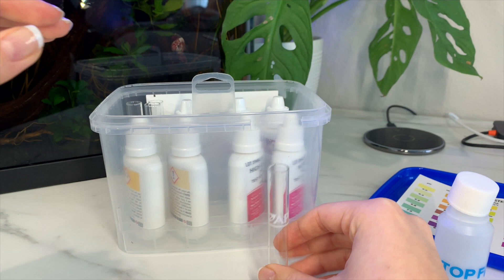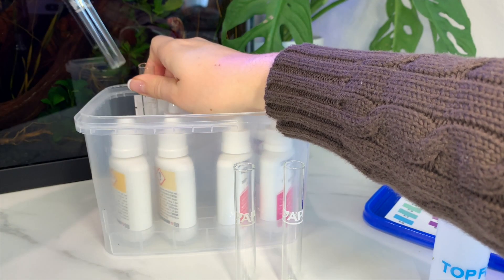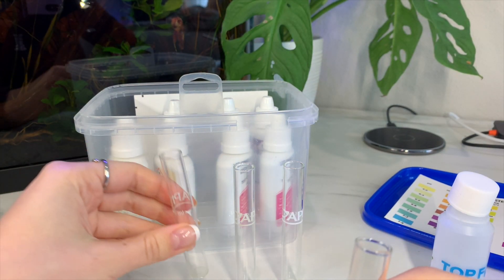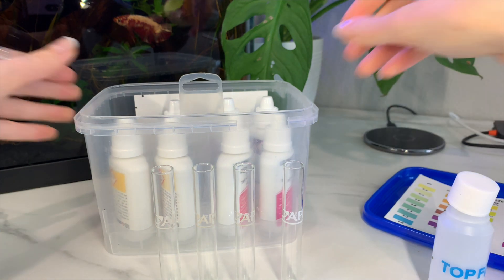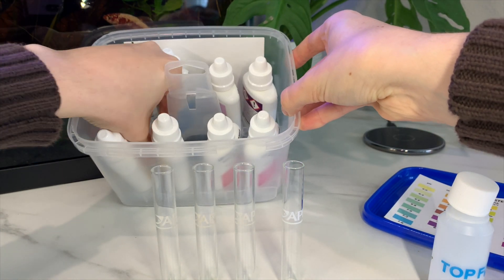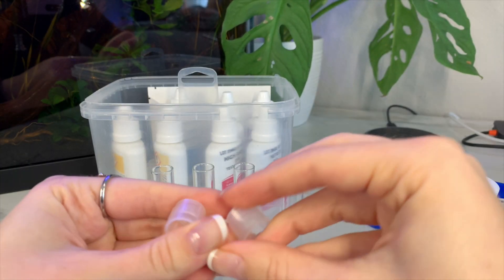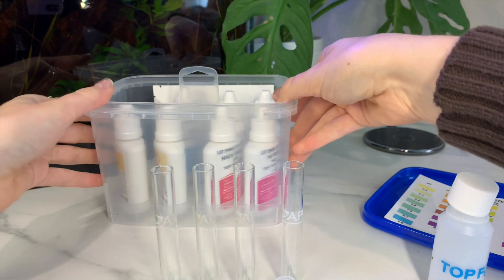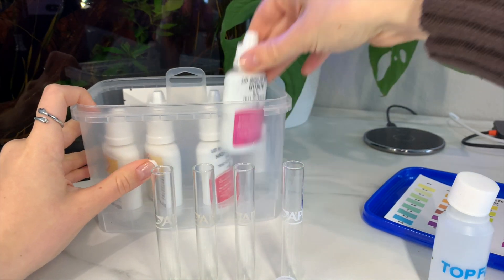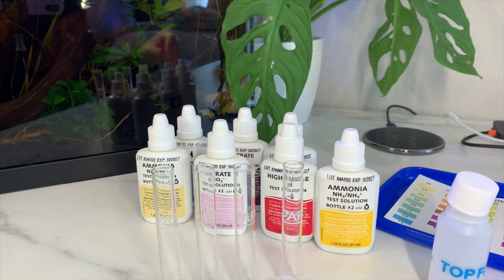In the kit you will have four vials. The lids are actually important and you will need to use these — so you have four vials and four lids. After that go ahead and grab each bottle out, and then you can put the box aside on standby.